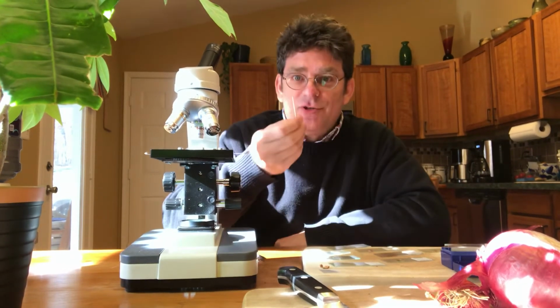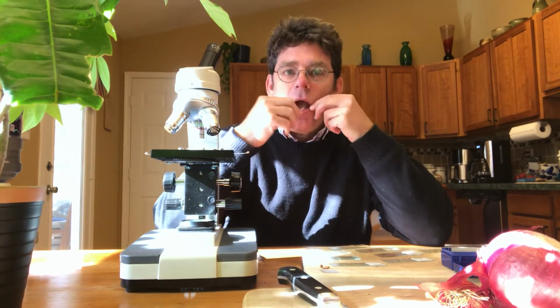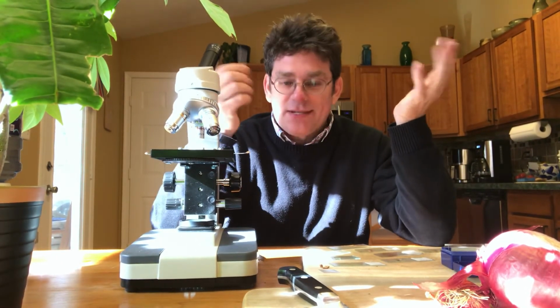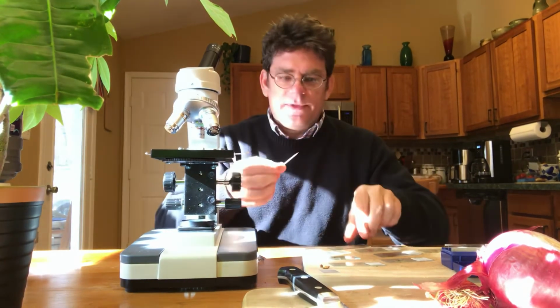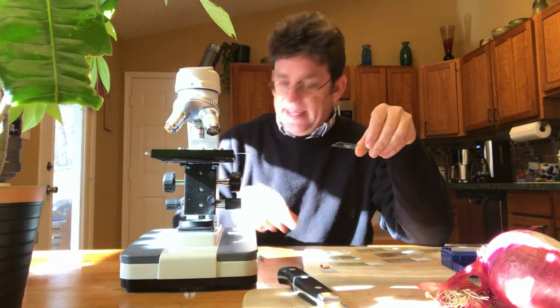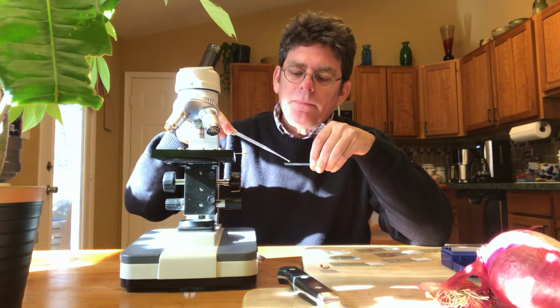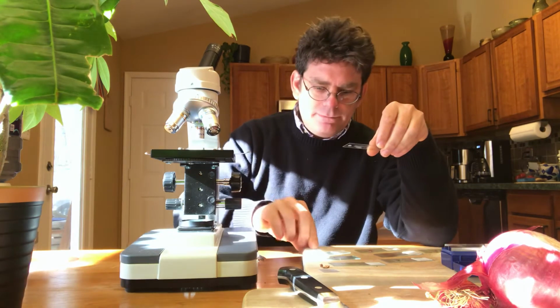So what I've got is a toothpick, just not a sharp one, and I'm going to try to look at the cells from the inside of my cheek. So I'm just going to take this and scrape my cheek, not hard, I'm not going to hurt myself or anything. Scrape the inside of my cheek, swipe that on the slide. Again, I can't see anything on here. And put a little drop of this stain on them so they show up a little bit better. Cover slip.